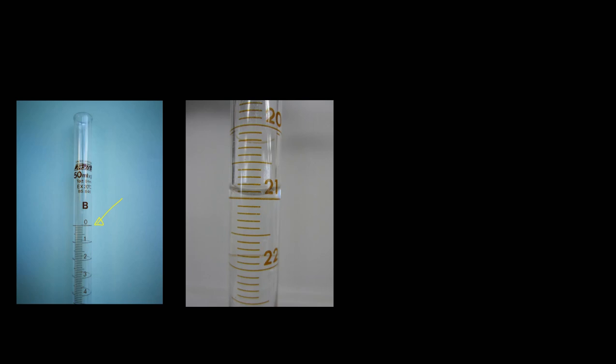When you fill up the burette with a liquid, you'll notice that you get this dip like this, and that's called a meniscus. So when you are measuring a volume in a burette, you need to make sure that you measure from the bottom of the meniscus. Not only that, but you've got to get along sort of exactly alongside it.